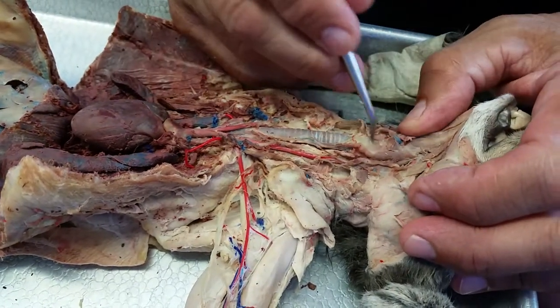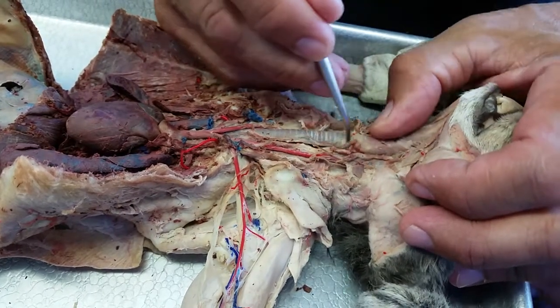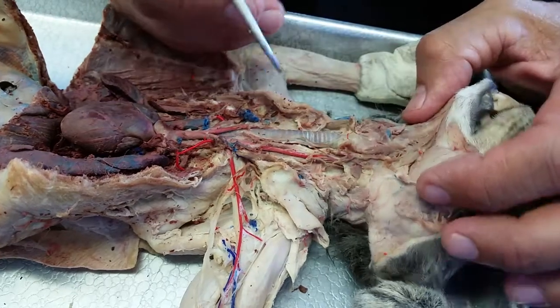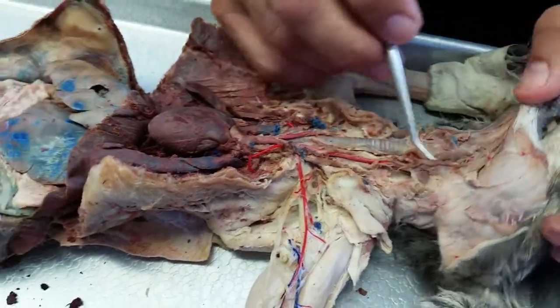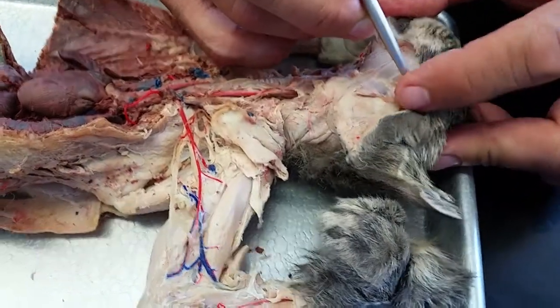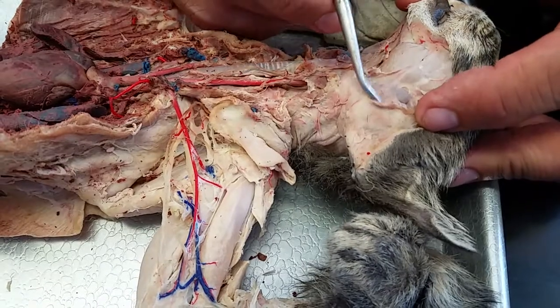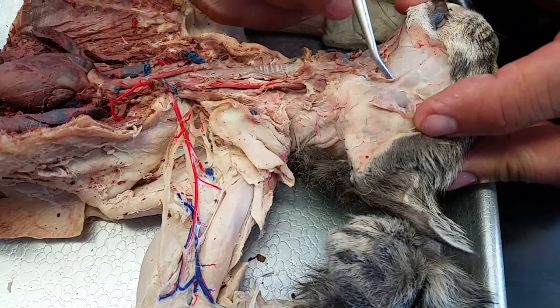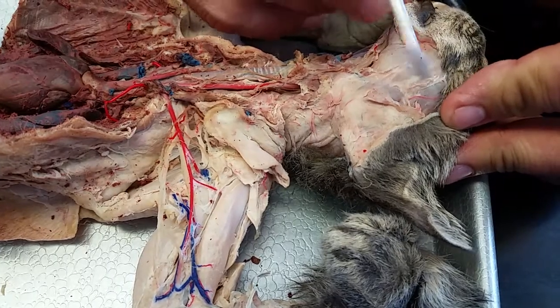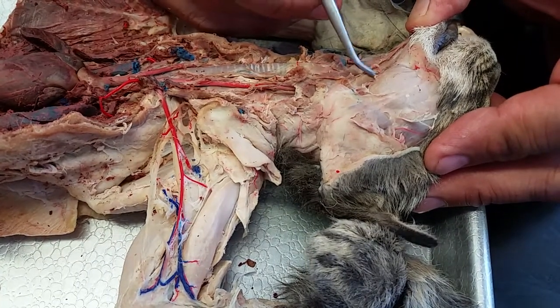That means there's a little tissue hanging off on each side, right here and here — that would be the thyroid of the cat. Up here, if we lift this way up, here's the temporal muscle, masseter muscle, digastric muscle. This is the parotid gland, so there's the parotid duct right here coming across. Here's the dorsal facial right there, and the ventral facial is kind of broken right here as a piece of it.